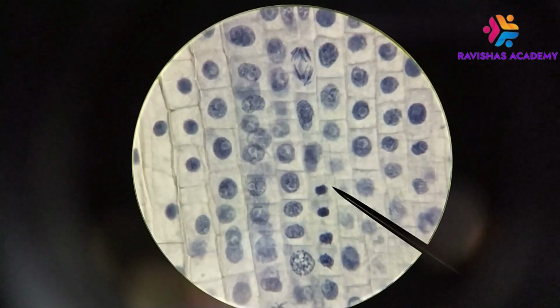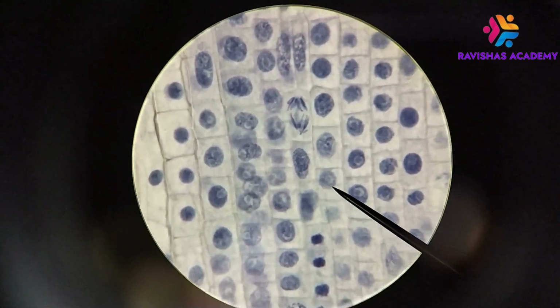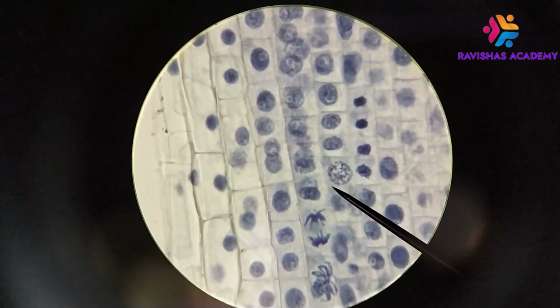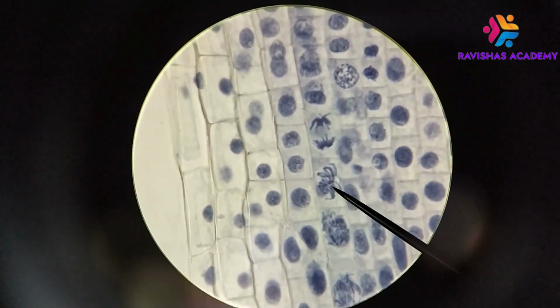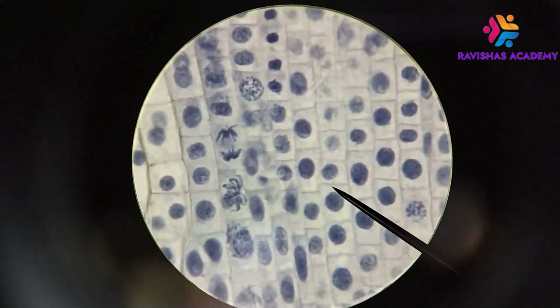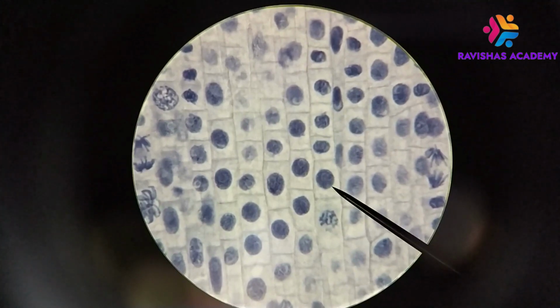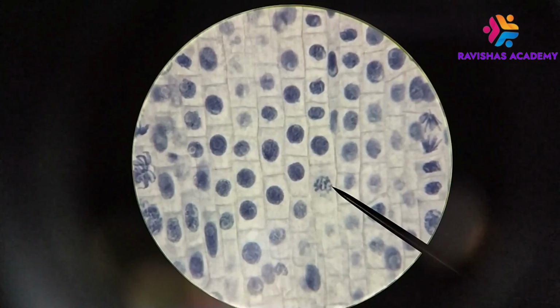If all the cells are kind of doing their own things, so here's a cell doing telophase, there's a cell doing anaphase, and in between them we've got a bunch of interphase nuclei, and a prophase nucleus here, and another anaphase right there, and the beginnings of metaphase here. All these different cells are doing different things. Each one decides when it's going to undergo mitosis. That is mitosis, okay?